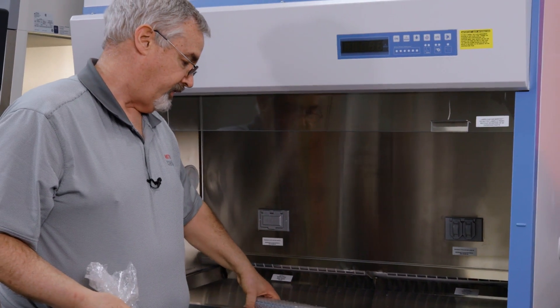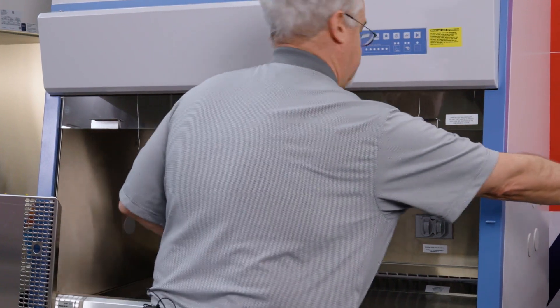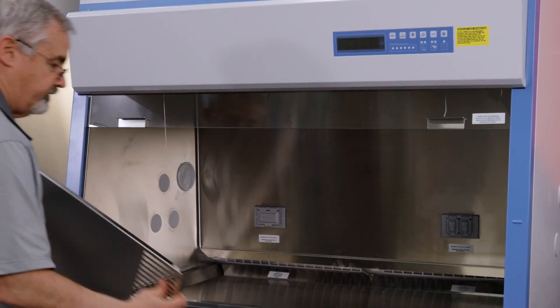We also have the armrest so let me remove this so we can install that and replace the work surface.